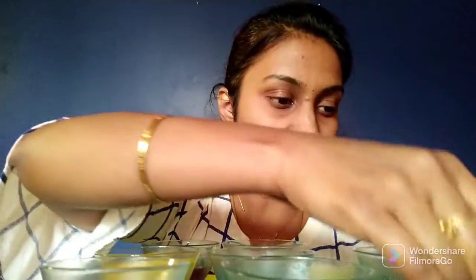I have taken lime as well as orange, and I have taken some baking soda also, and I have prepared some soap solution also. I have taken vinegar also, and some soda. Using all these substances, using turmeric as well as China rose, I need to find out which substance is called an acid and which substance is called a base.